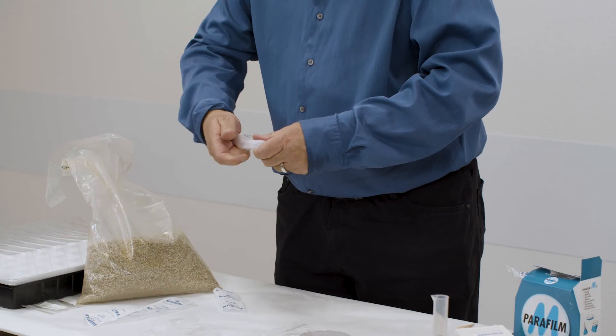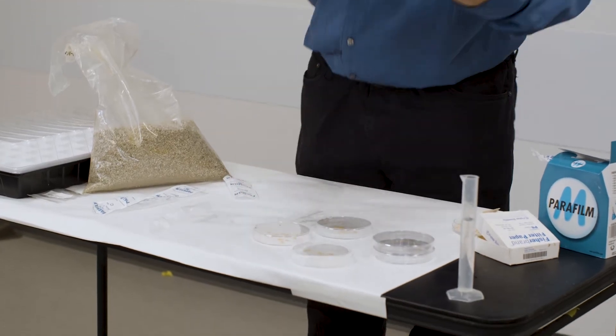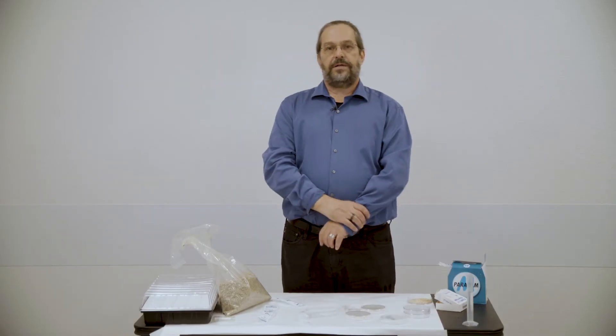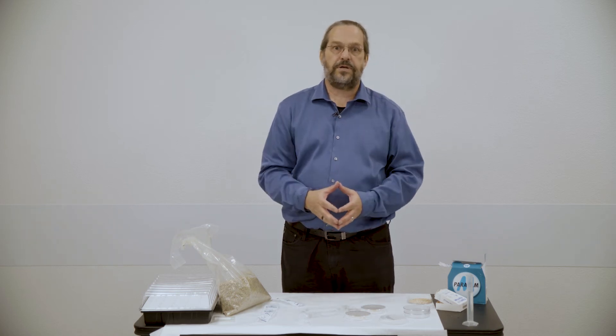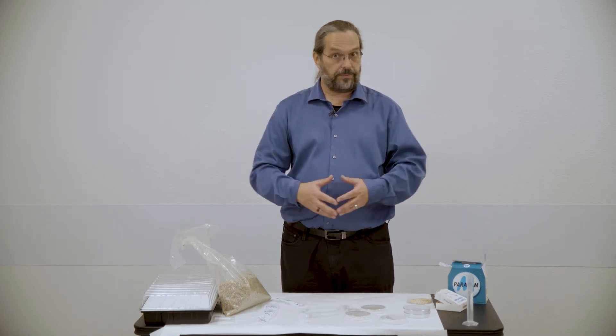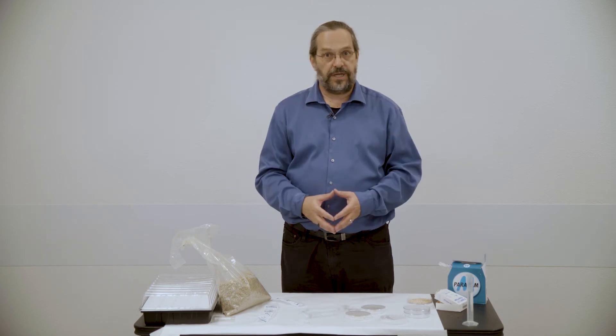All right. There. All right. So now you're going to let that sit. Typically, I let those sit a week because the way the course works here at ASU's West Campus is we meet once a week. Next week, the students would look at them for percent germination.